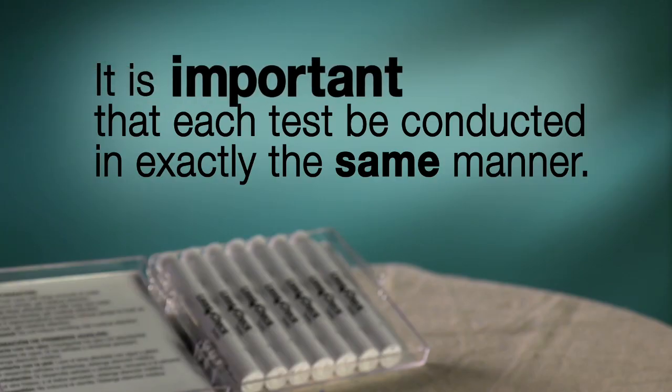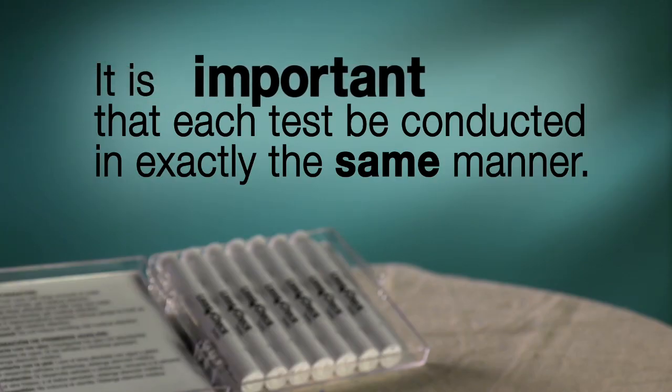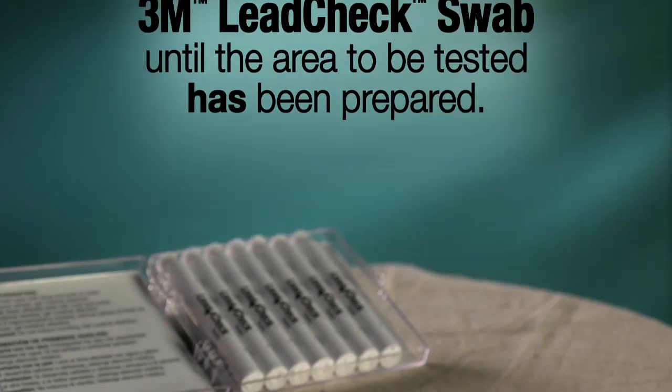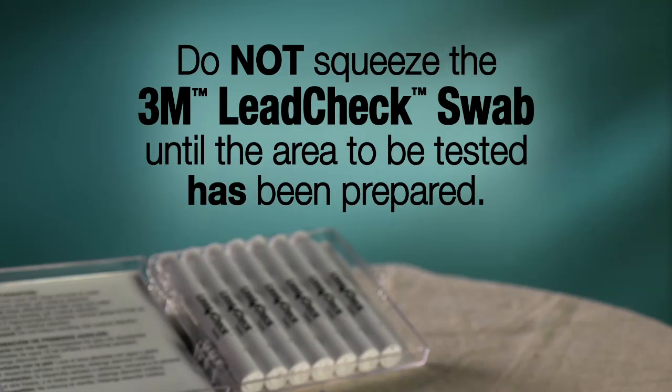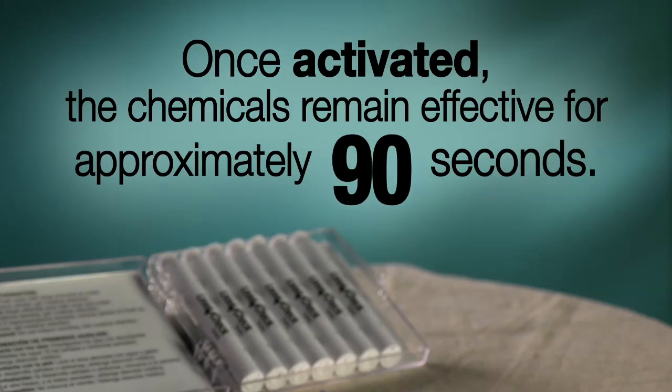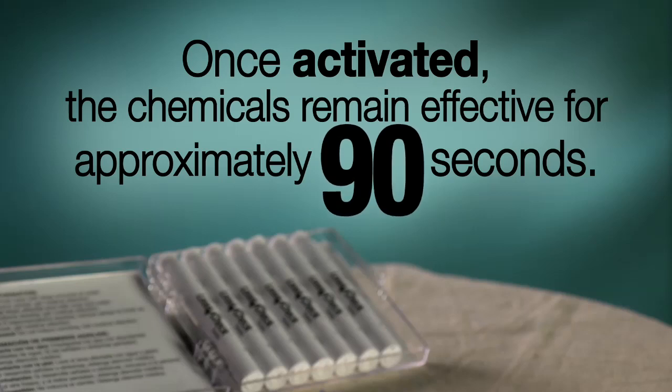It is important that each test be conducted in exactly the same manner. Do not squeeze the 3M Lead Check swab until the area to be tested has been prepared. Once the chemicals inside have been mixed and activated, they remain effective for approximately 90 seconds.